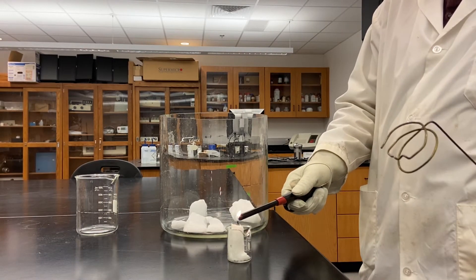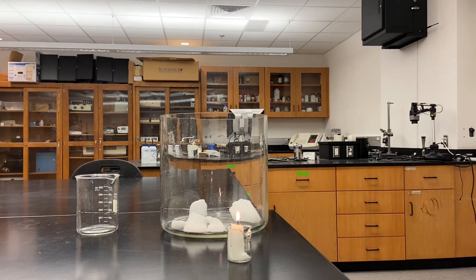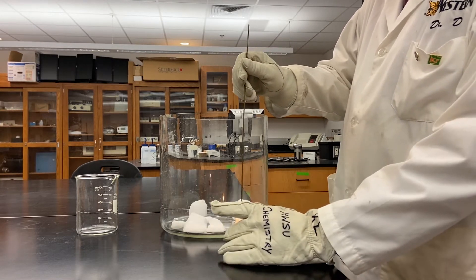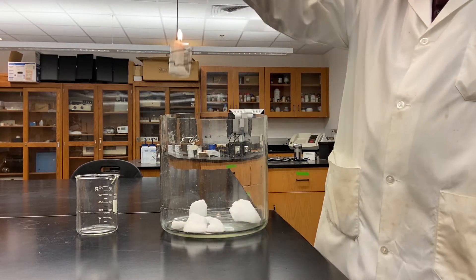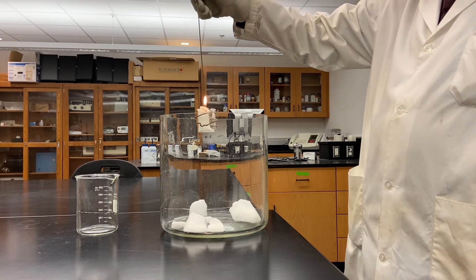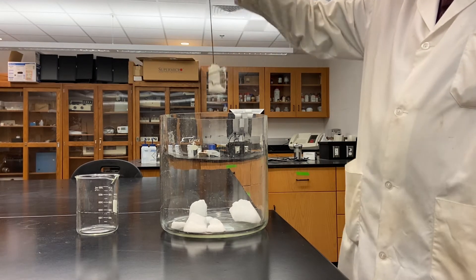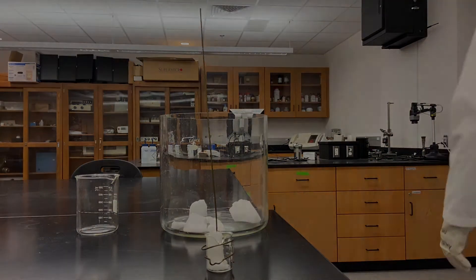In order to burn something we have to have a couple of different things: we have to have a fuel source — in this case the candle is acting as the fuel source — and then we have to have oxygen to help support that burning. I'm going to place my candle into this little holder so we can dip it down into our container of carbon dioxide and see where the level of carbon dioxide is, because the candle will snuff out. You can see this container is already full of carbon dioxide because it's unable to support burning below about right there.